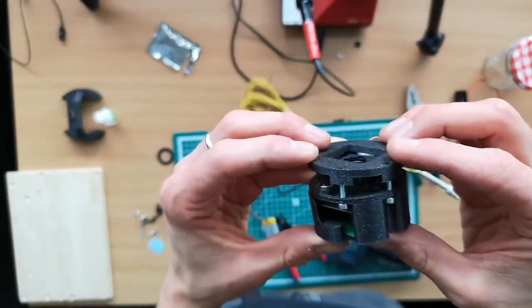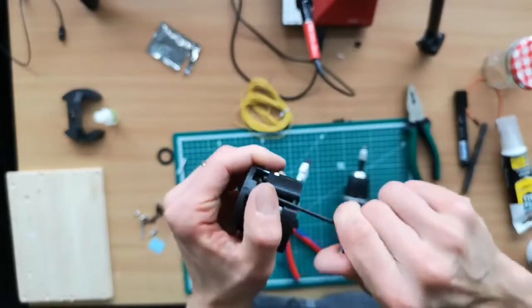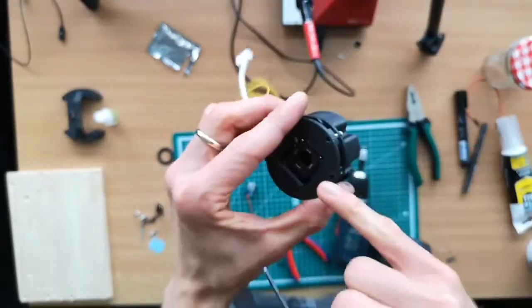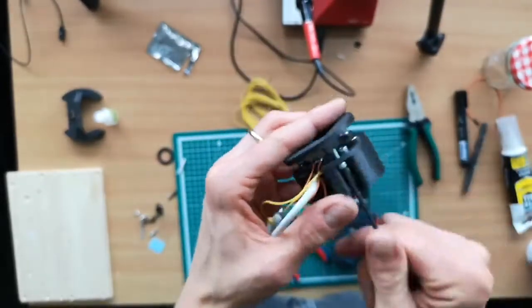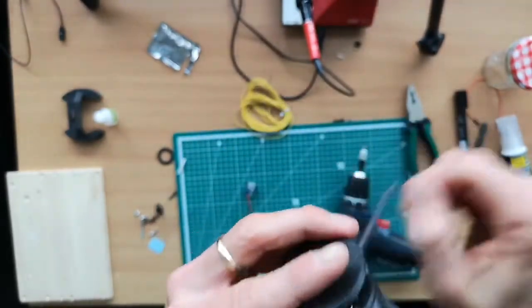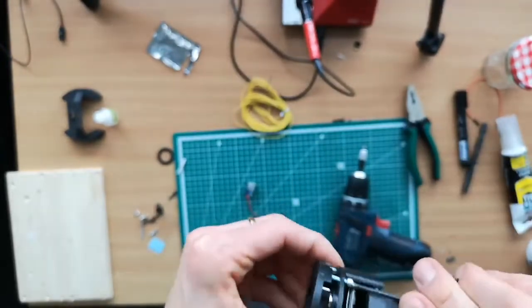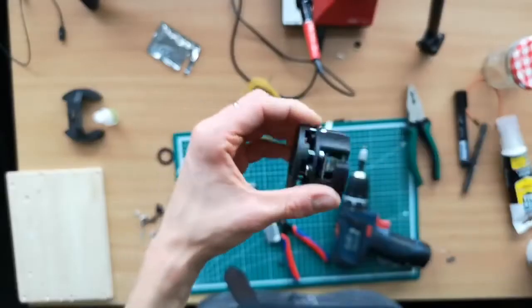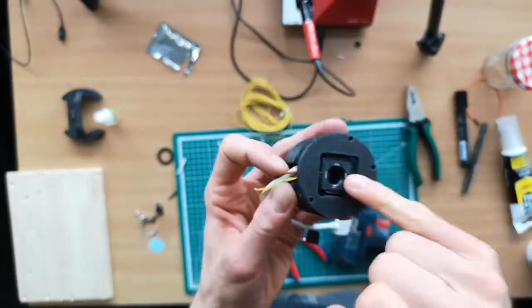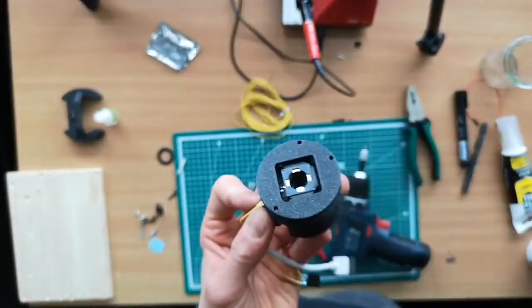Focusing stage, so it's completely not aligned, as you see, it's completely odd. But if you rotate the Allen key, you see that this distance between the screw and the stage here is reducing, and that way you can tune the distances here. So you can essentially move it up and down in focus. That's the whole point. So here we'll make it a little tighter. And then the next step is to mount the lens, and then finally mount this on the jar lid.